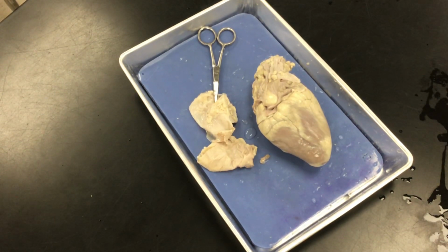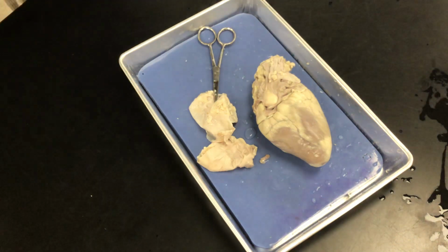This is the left side, right? Right. This is the right side. There's a fly. A bug? There's a bug. That's a blood clot, actually, I think. Oh, it's an actual bug. Ew, there's a bug in my heart. There's a bug in your heart.